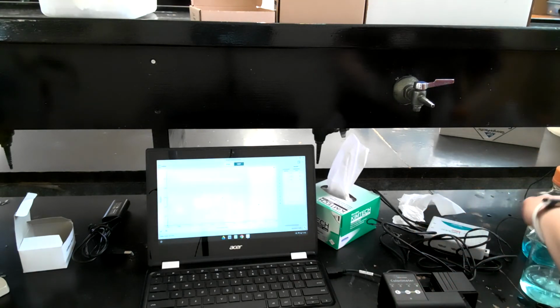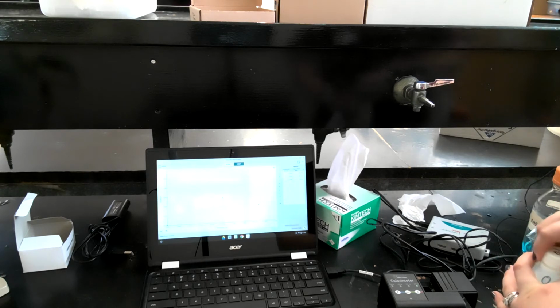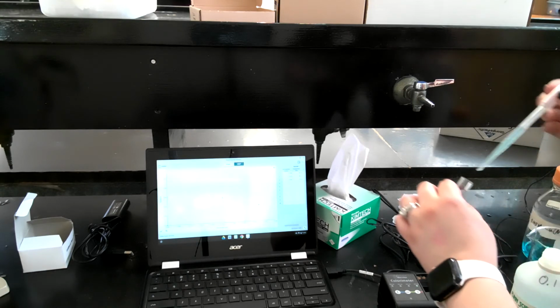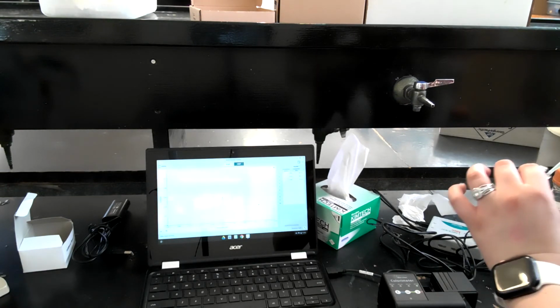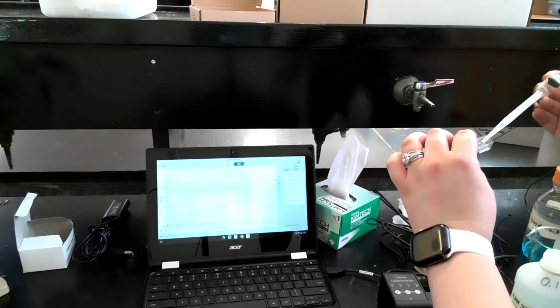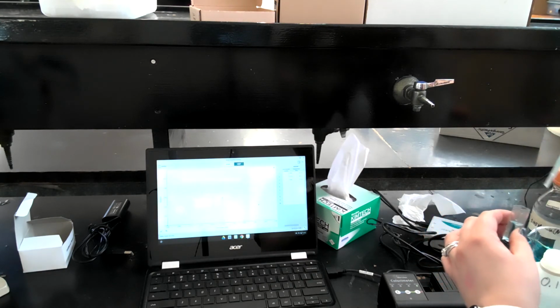I'm going to empty this out, rinse it, and I'll show you guys with the last one what I'm going to do, and then I'm going to do the other 2 on my own, and then have you guys take a look at the graph after I do all that. Okay, so I'm going to do the same thing. I rinsed it out with water, rinsed the sides with my solution that I'm now going to be testing. So I'm just going to rinse the sides a little bit better this time. There we go. Okay. And I'm going to fill this up 3/4 of the way full.